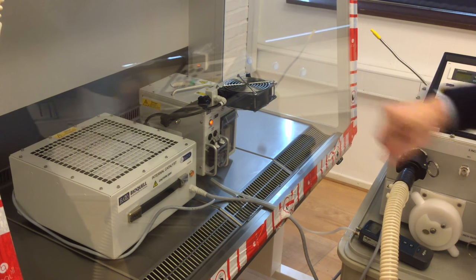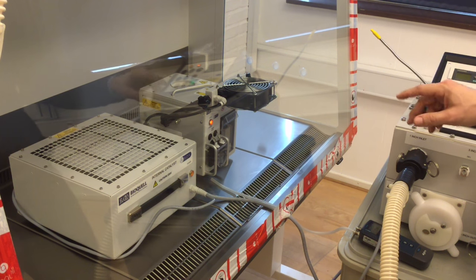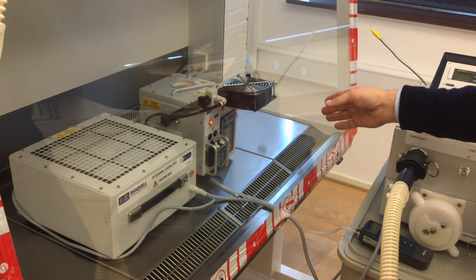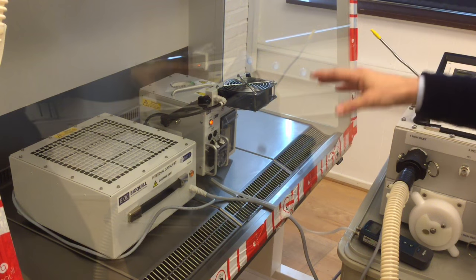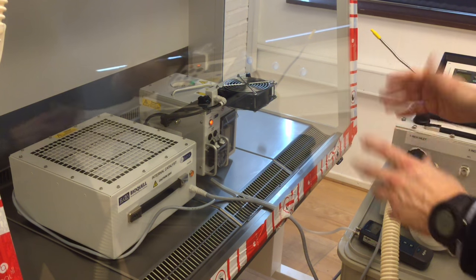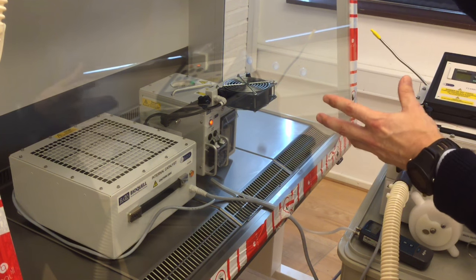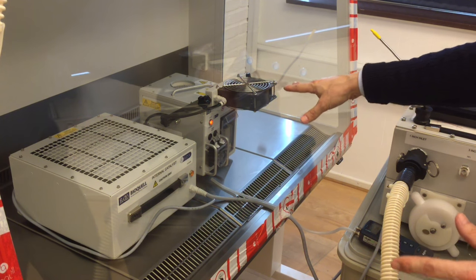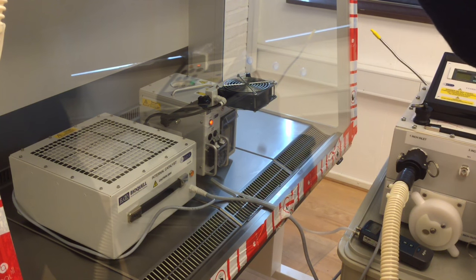Now as you can see the vaporizer inside is powered on and the pump is starting to rotate. This means that it is taking hydrogen peroxide from the bottle inside to the vaporizer plate which is 140 degrees. So the vapor will go into the chamber and by the help of the fan be distributed to the whole of the chamber to the downflow filter.